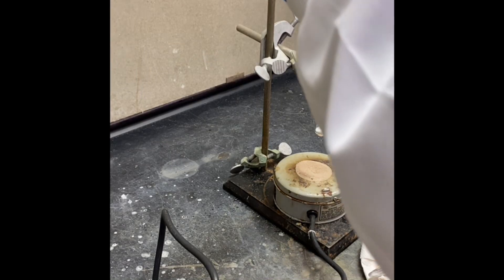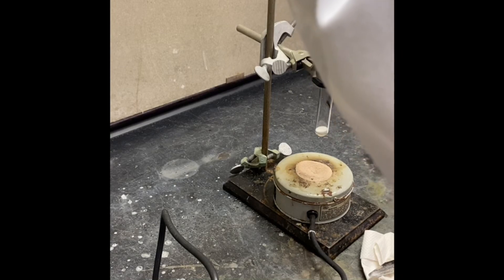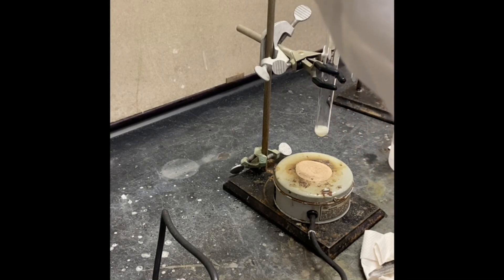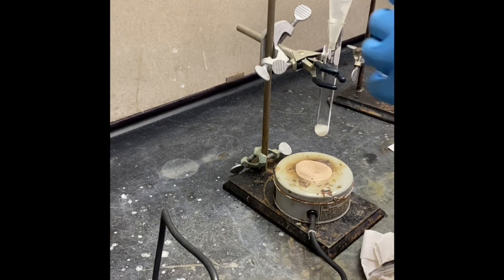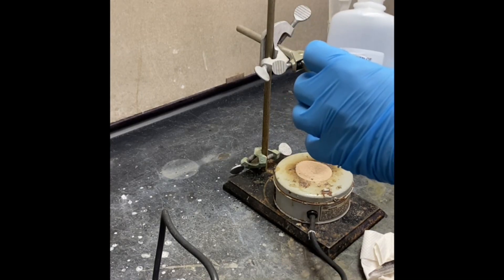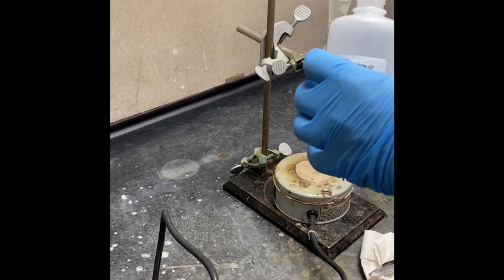I have another one mL. That was the first mL and this is the second mL. Now I'm rinsing my powder funnel.